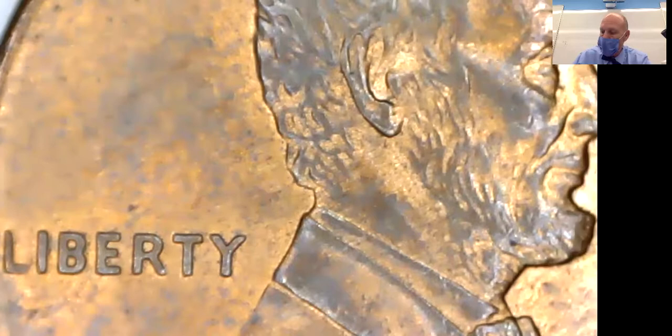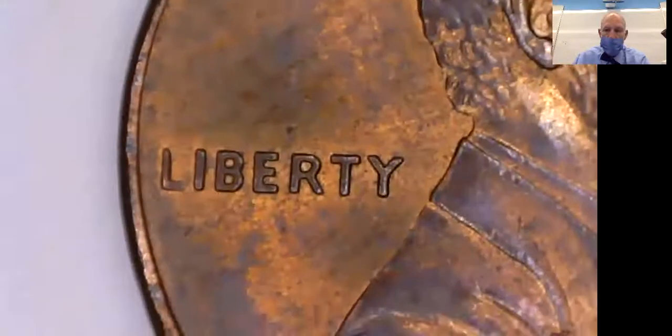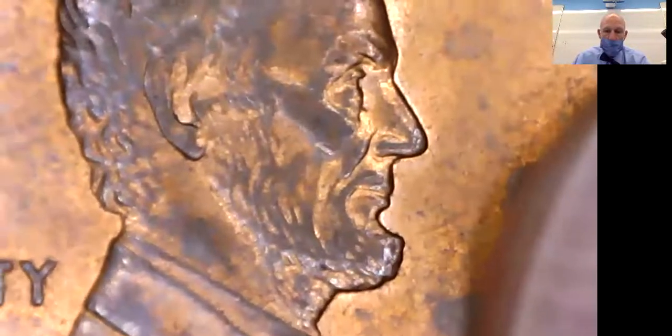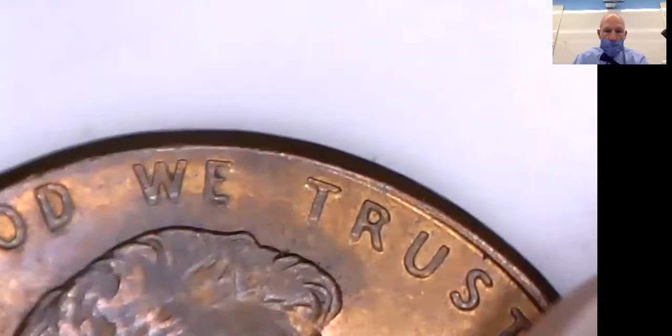And the thing is, when you look at a stage under the microscope, you got to remember that everything is backwards. If I want to move things up, I actually have to move it down on the stage. If I want to move them to the left, it's actually to the right. So everything is going to be the opposite of what you think. And that'll become important if I'm chasing little critters around under the microscope, some live creatures that are really small. You get used to it after a while.